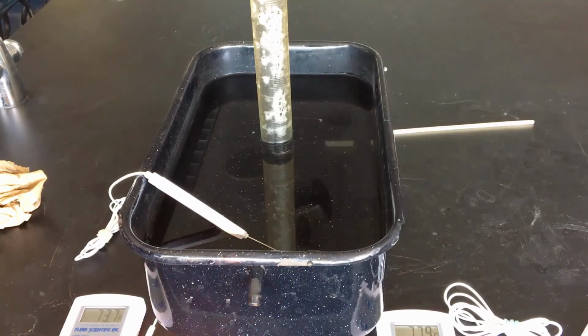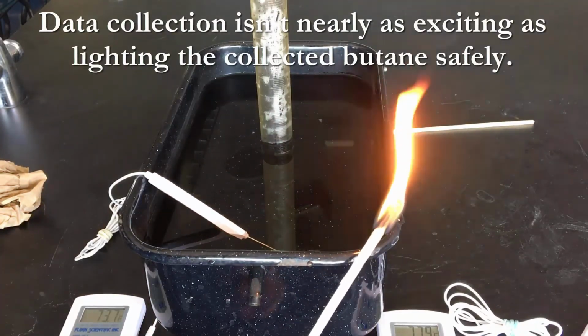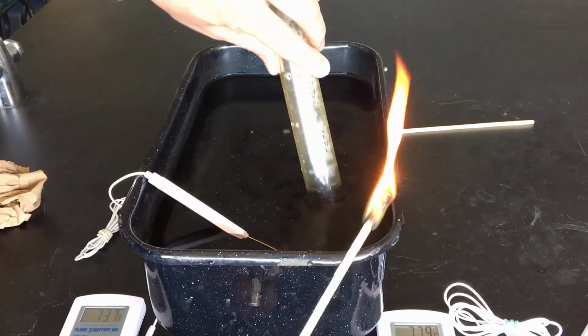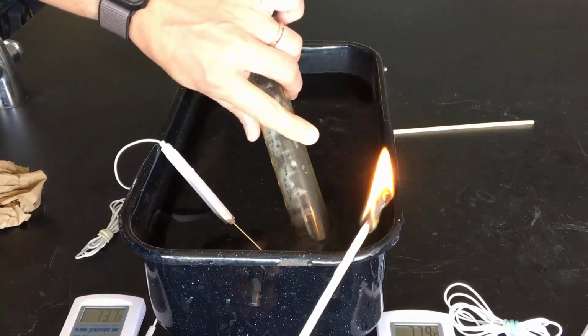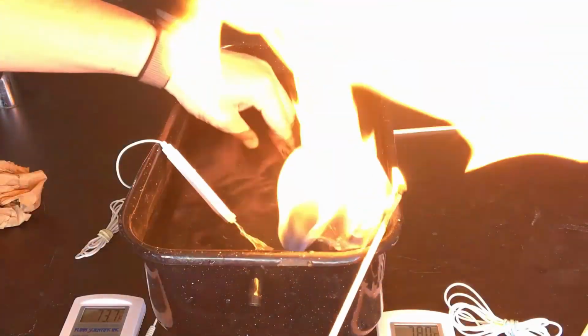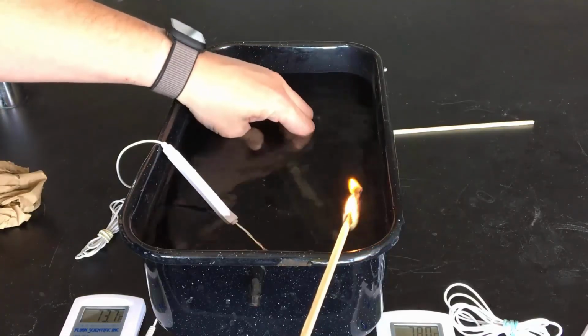Now, it was pretty boring to collect data, so let's go ahead and ignite the butane that we collected. A little fireball makes this all much more satisfying. Hopefully you enjoyed the lab. Make sure you take care of your lab write-up.